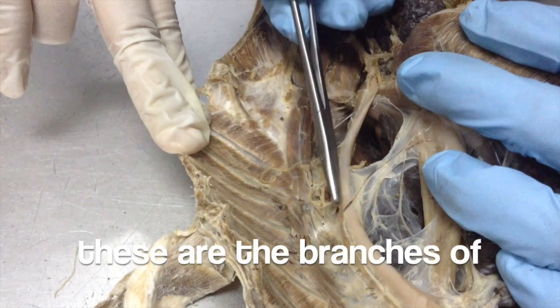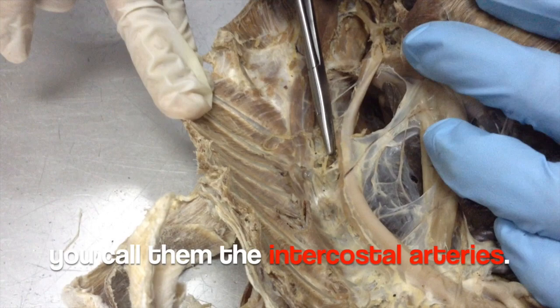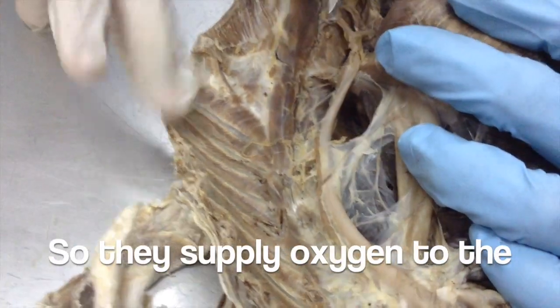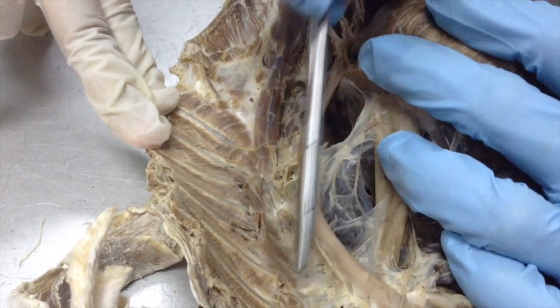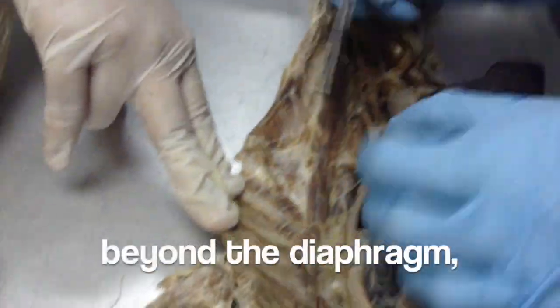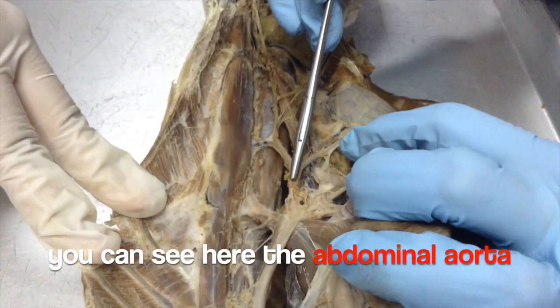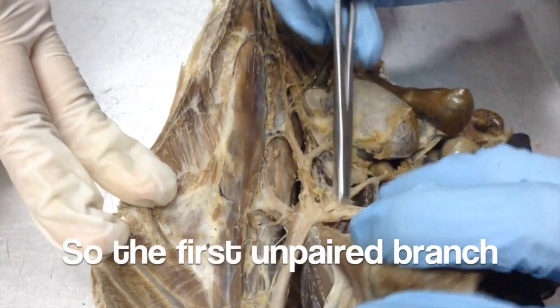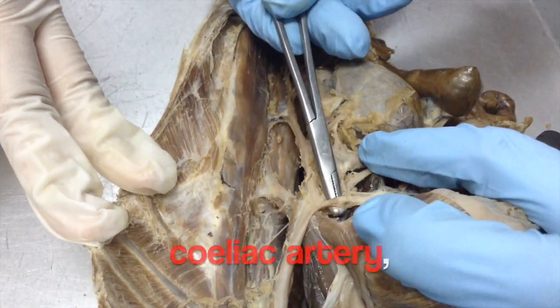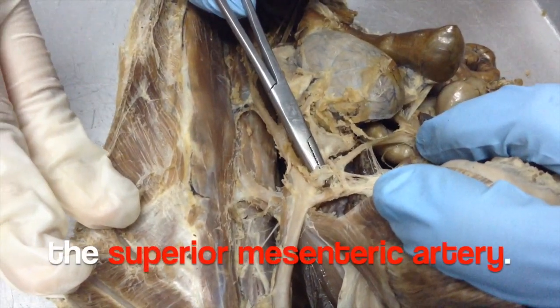You can see here the branches of the thoracic aorta. We call them the intercostal arteries. They supply oxygen to the intercostal muscles. Beyond the diaphragm, you can see the abdominal aorta. The first unpaired branch of the abdominal aorta is the celiac artery, followed by the superior mesenteric artery.